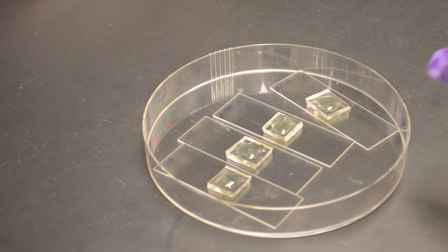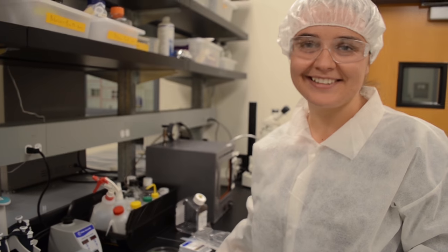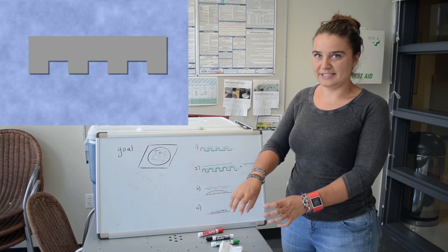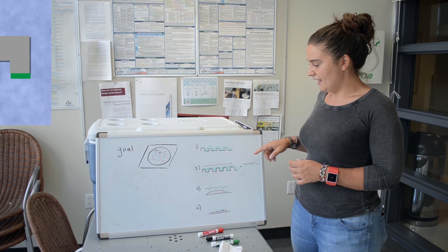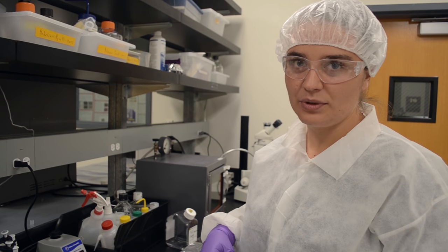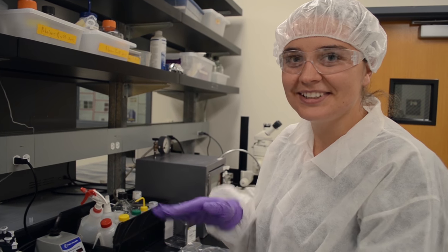These are the rubber stamps that have micron-sized features, and basically we just ink the stamp with protein. Like if you've ever played with stamps as a kid, right? You put the stamp in some ink. And so I basically inked the stamp with protein. So that's step one. And what we're gonna do is take that off. Then we're gonna rinse it once, and then we're gonna dry it. And then it'll be ready for the stamping part.